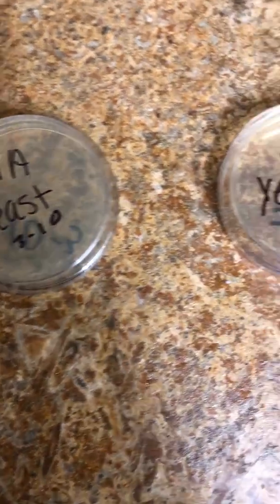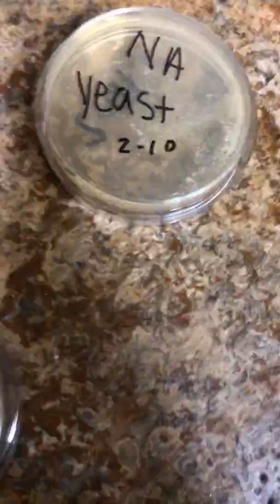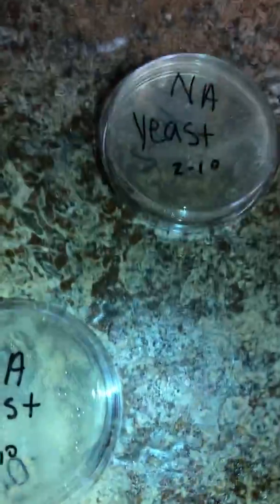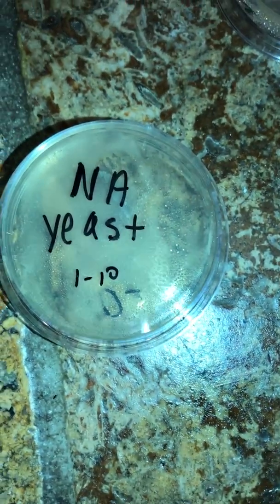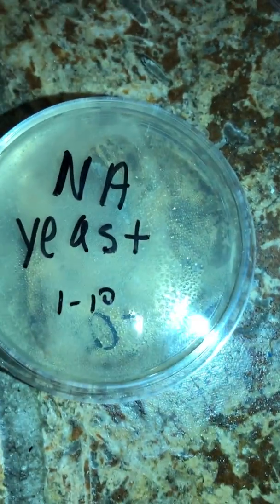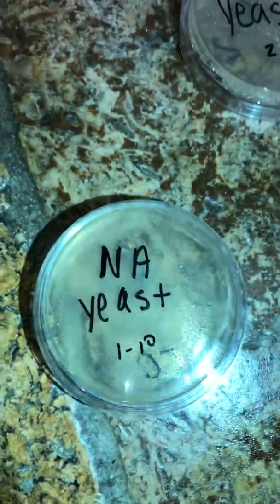I basically had to go through each one of my specimens to try to figure out which one would be a good candidate. So I'm going to go ahead and shine a light on these. Here is my 1-10. As you can see, the specimen growth is very great. There's no way possible that I would be able to calculate all of these because the amount is way too many. So that one would not be a viable one.